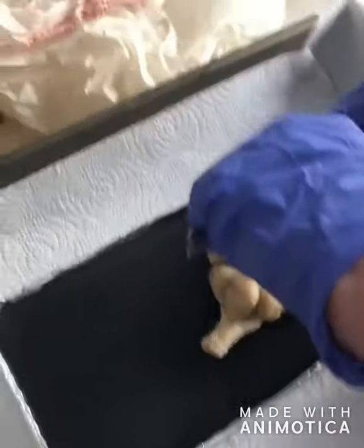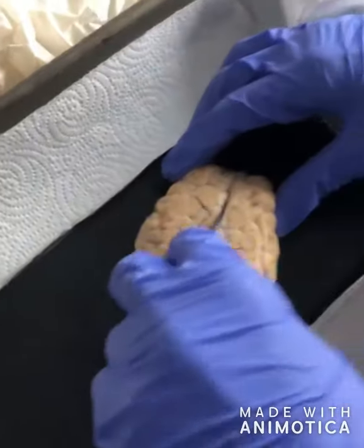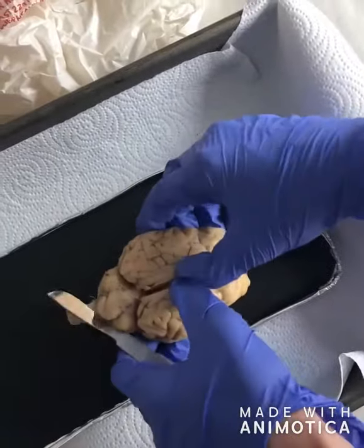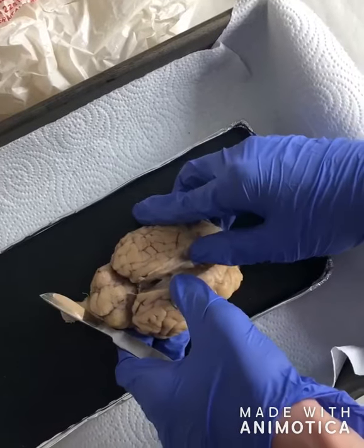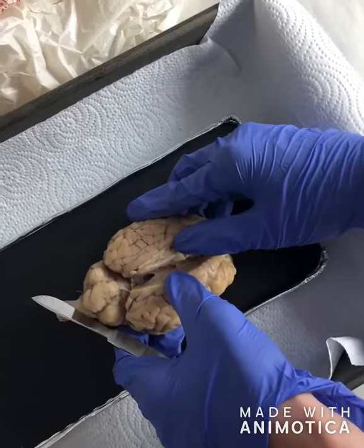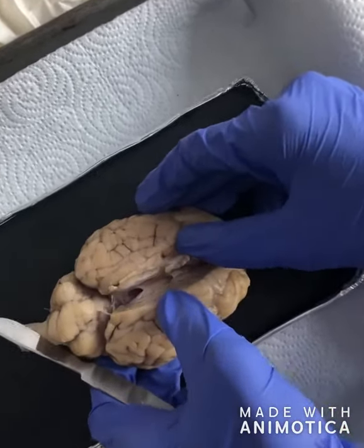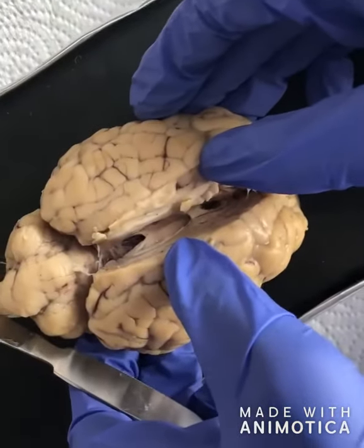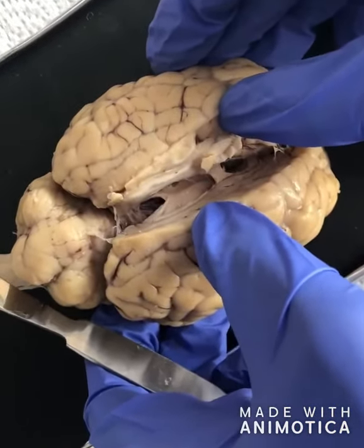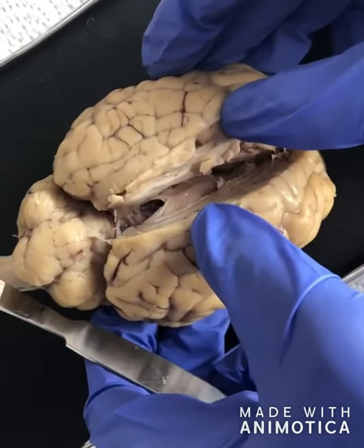As we begin to cut into the brain, you can see here the fourth ventricle, which extends from the cerebral aqueduct to the obex, and it's filled with cerebrospinal fluid, CSF. It's a diamond shape in cross-section in the human brain, and it's located within the pons, or in the upper part of the medulla. A ventricle is a hollow part or cavity in an organ, and there are 4 ventricles that are connected to each other and fluid-filled in the brain.